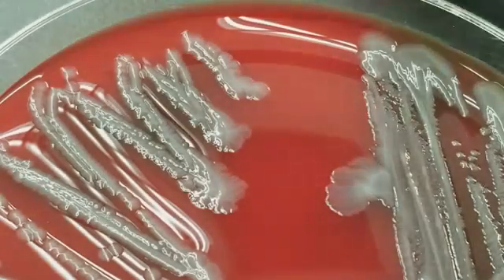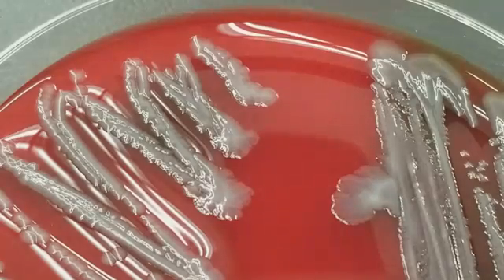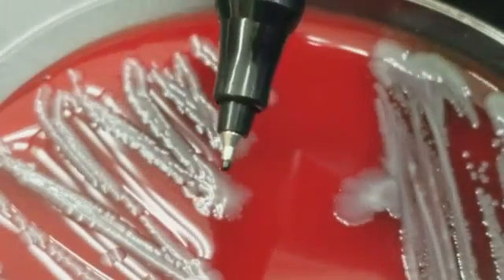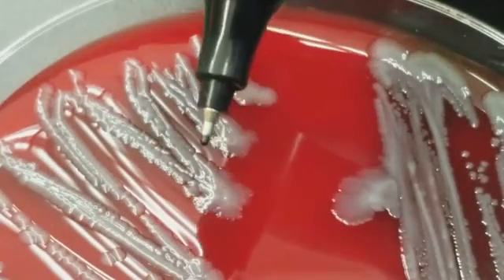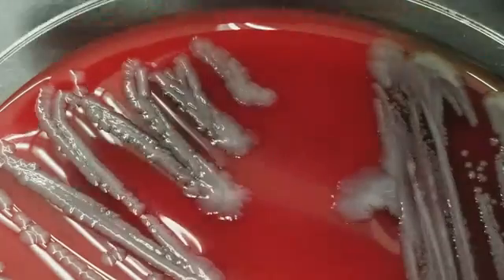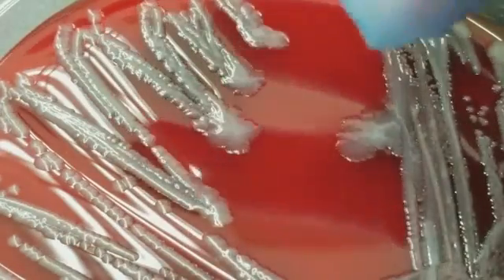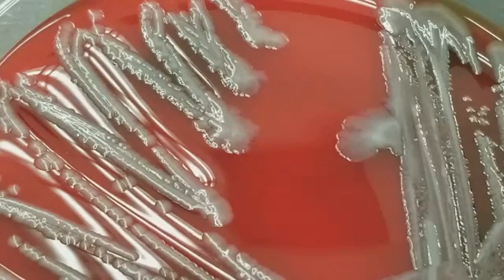Notice that it has kind of almost like an apron around these end parts of the lines, okay? It kind of fans out. That's very, very common with a GNR, okay? Your Enterobacteriaceae family ends up having that a lot. And the colonies look bigger because the rods are bigger usually than the cocci, okay? So you would expect larger colonies anyway, but that scalloped edge is very common with the GNRs, okay?